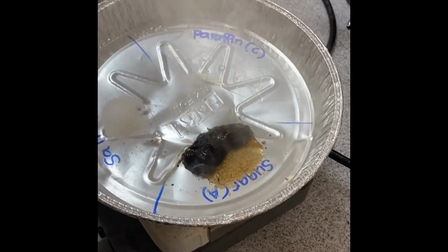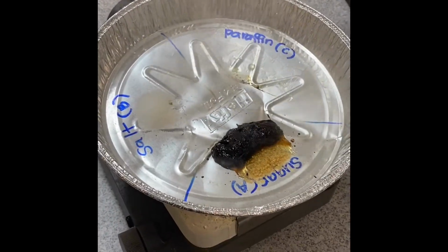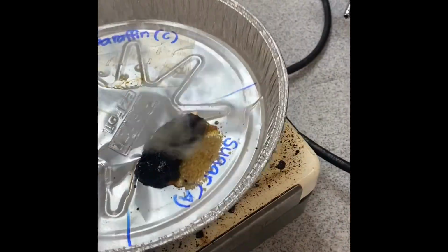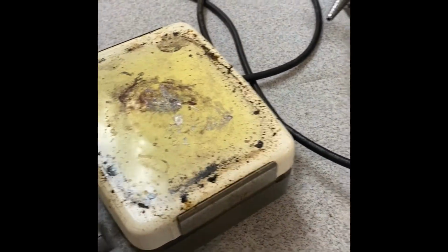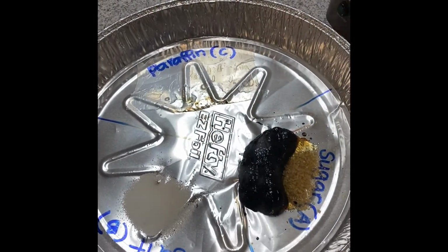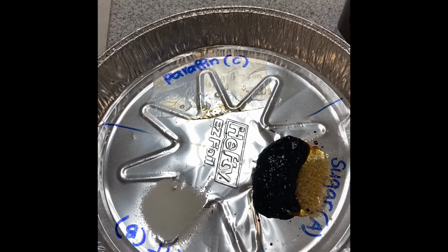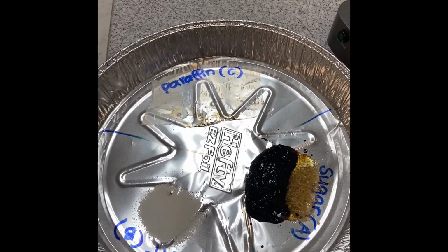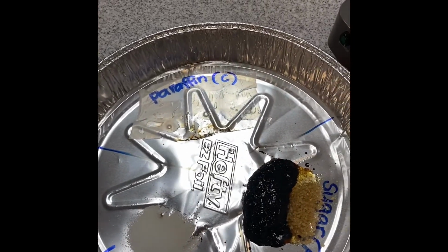All right, so hopefully you've made some observations. You have your melting order from the handout. Okay, time that it would take the substance to melt. You don't have to give a number in terms of that, but just which substance melted first, which one melted second, which one third if melted at all.